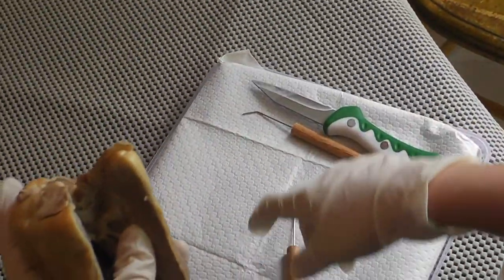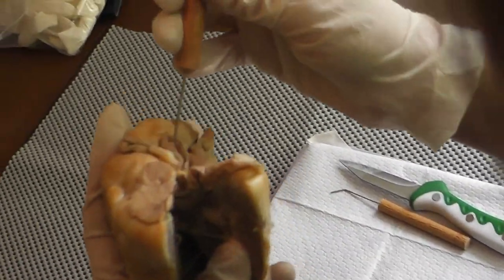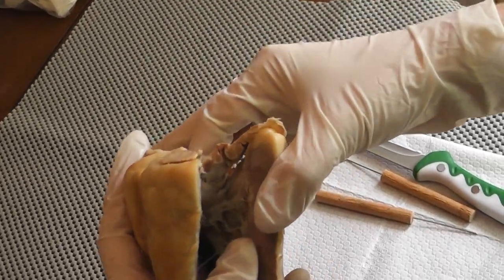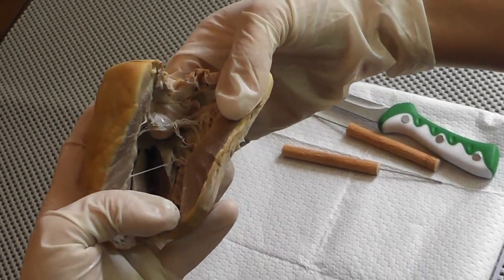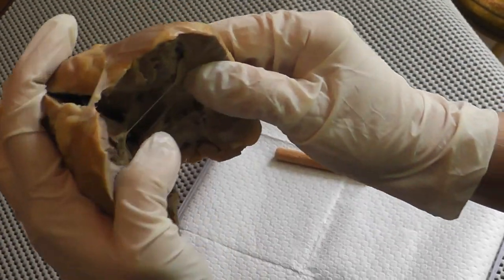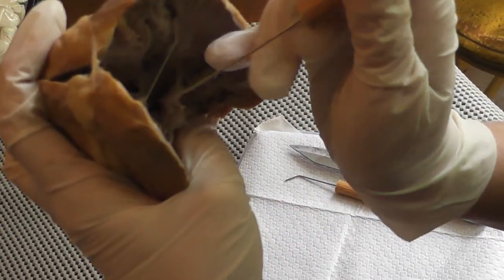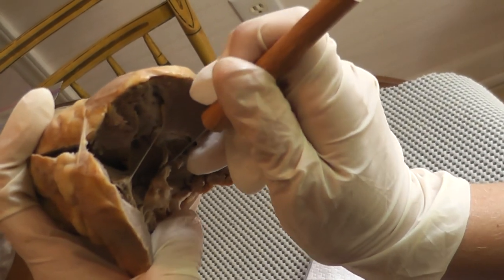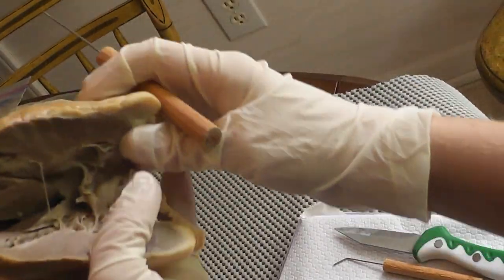Also the way to tell that this is the left chamber of the heart is because of this artery right here, the aorta. If I put my finger through the aorta, it should go into the left ventricle, and there's my finger, so it went right through into the left ventricle. If you look through the aorta right there, this flap of tissue right over here is the aortic semilunar valve. This flap of tissue right over there.